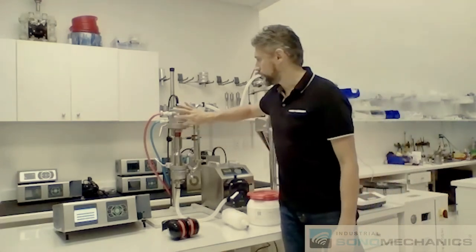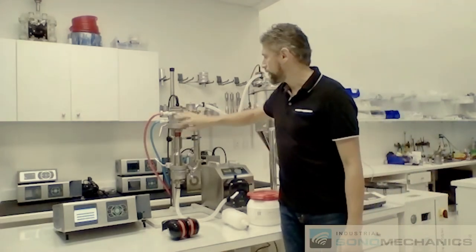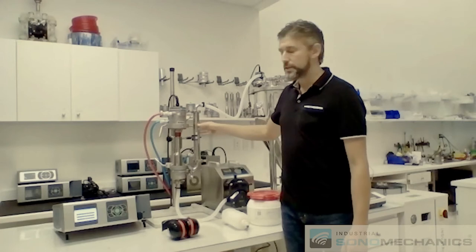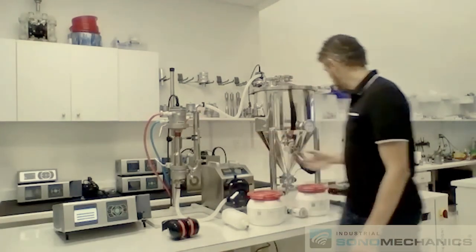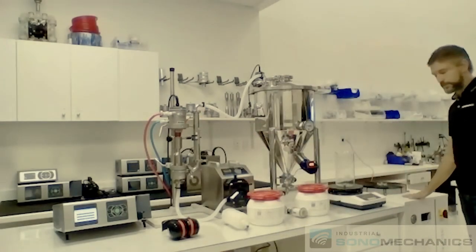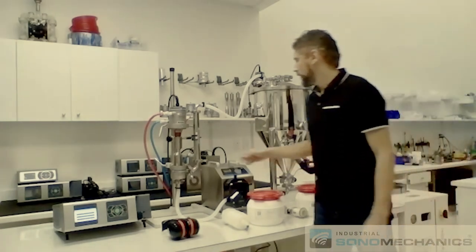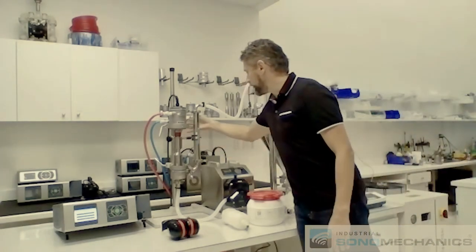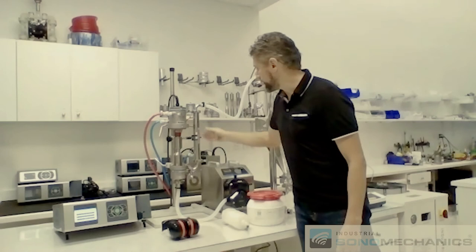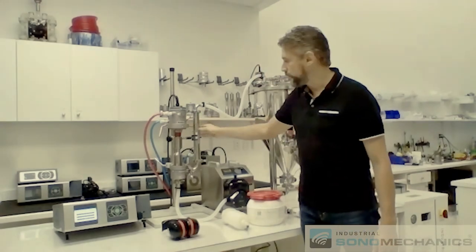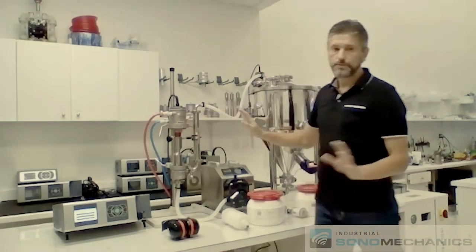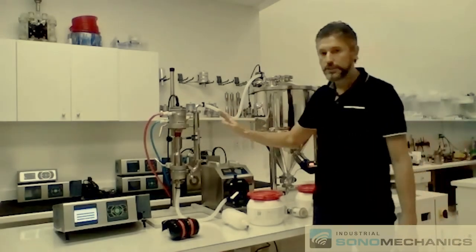It's also important to continuously cool the transducer. Both the transducer and the heat exchanger require chilled water from a common chiller. It's back here. And then the lines are split and channeled appropriately. So some of the water goes to cool your liquid. Some of the water goes to cool your transducer. You don't ever have to worry about it. It's going to take care of itself.